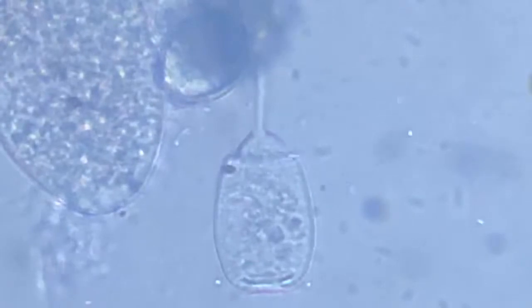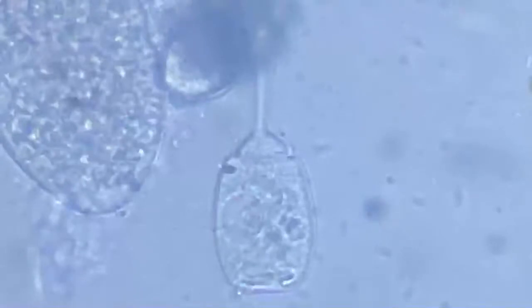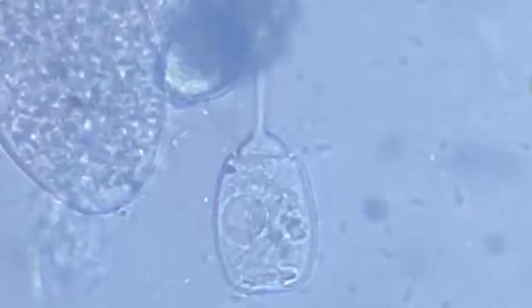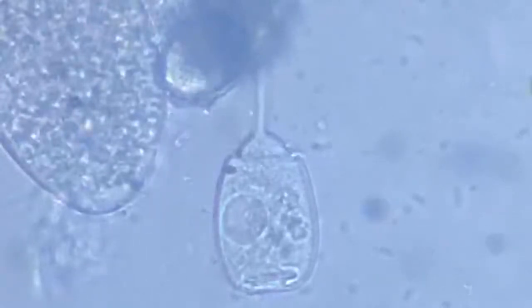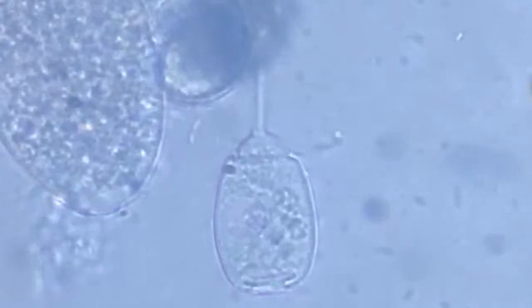Are those bacteria or are they the flagella? Because obviously at the lower tip, as we see, the lower end, there isn't any set of flagella. This looks pretty different from the general.